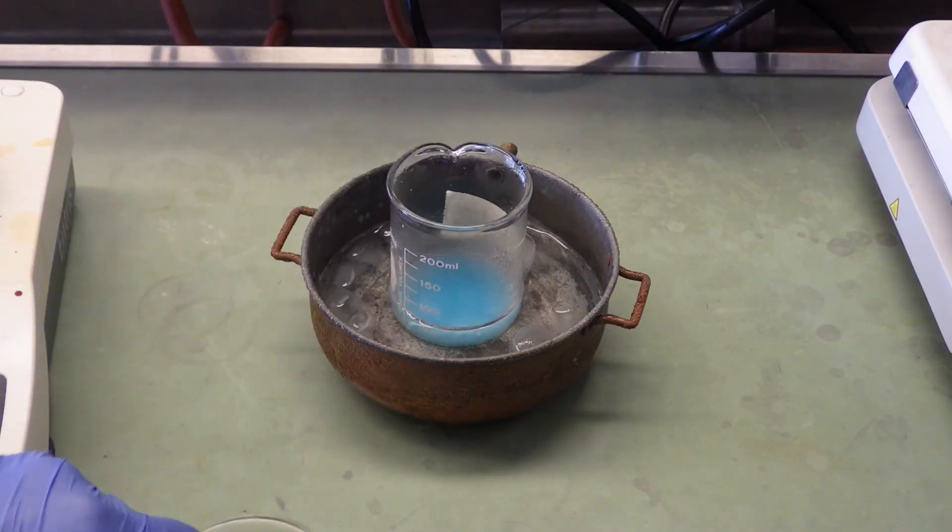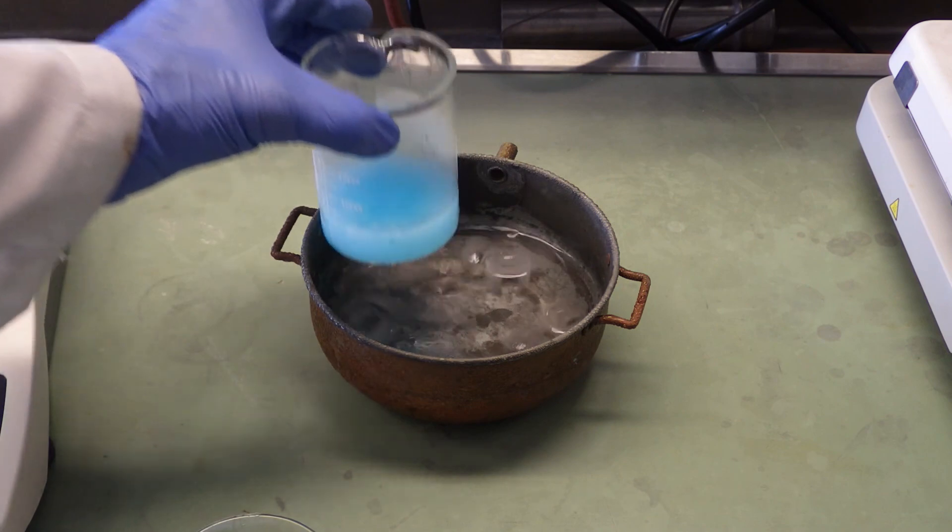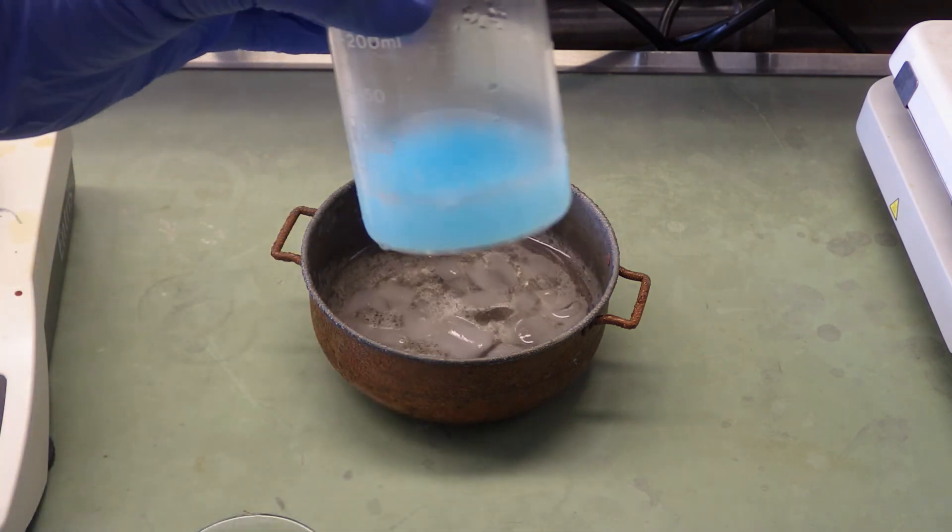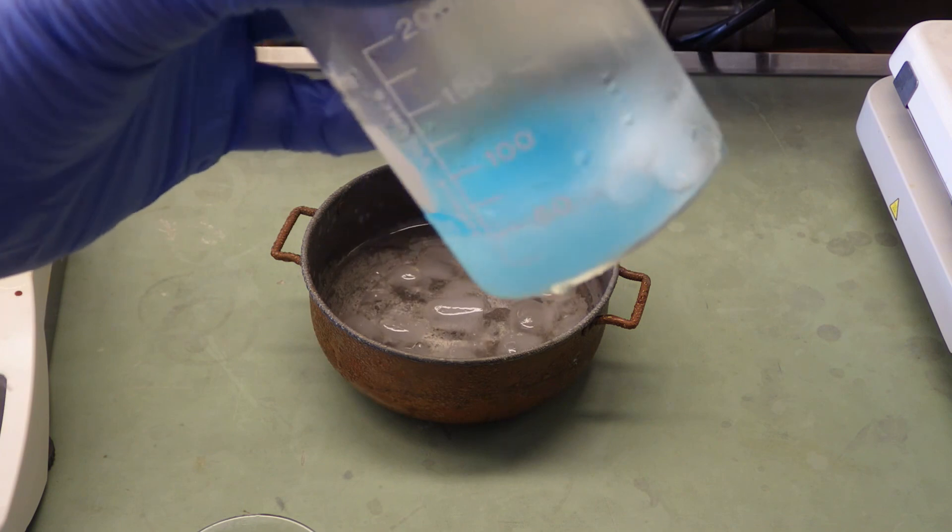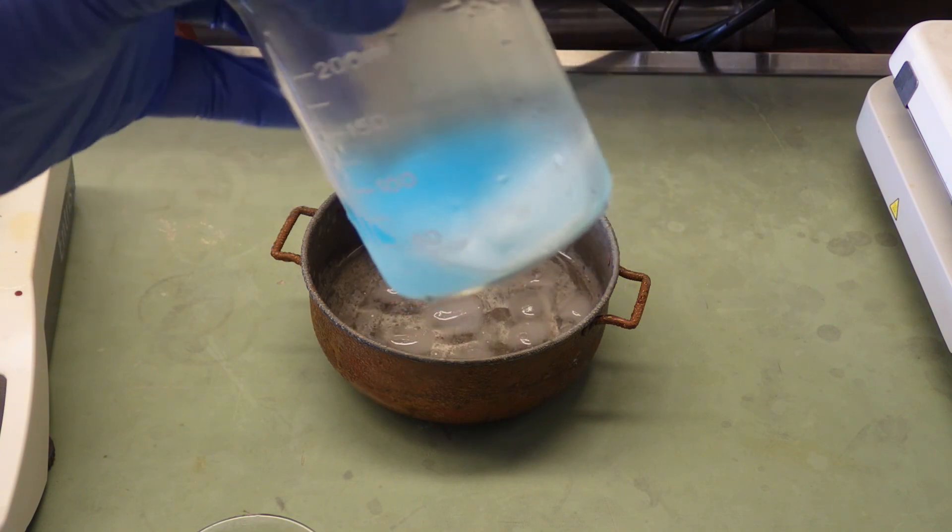So our slurry has sat in the ice bath for about 10 minutes now. Looks like a pretty good collection of solid salicylic acid. Kind of looks like a slushie.